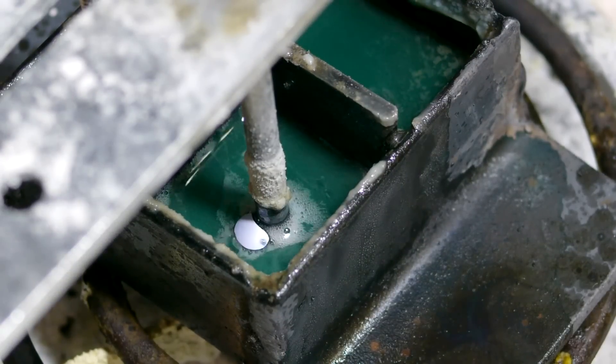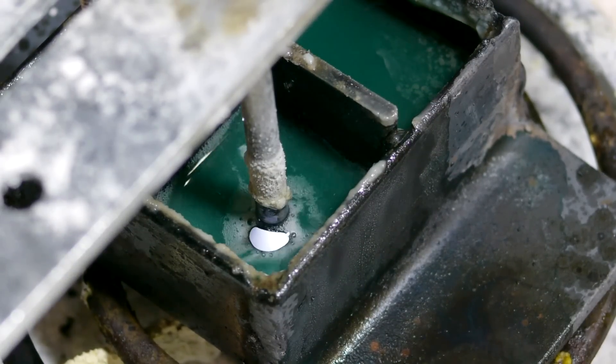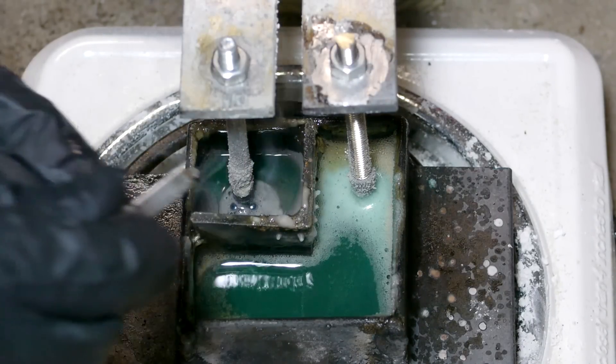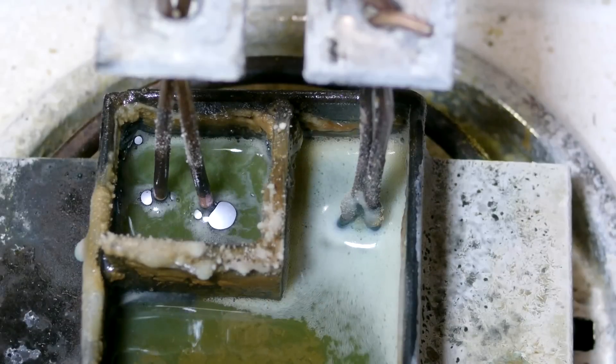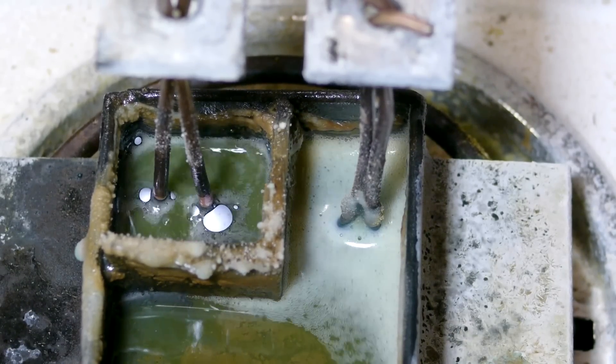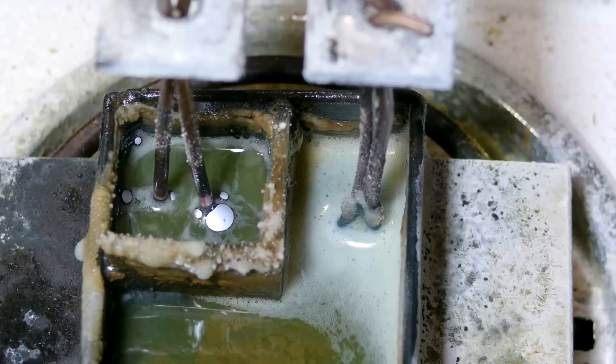In this case, the solution is turning a dark green color because, on the suggestion of some patents I found online, I've switched the anode out for a nickel-plated rod. I also tried some other electrode materials, including copper. This also worked fairly well, but nothing special over steel.